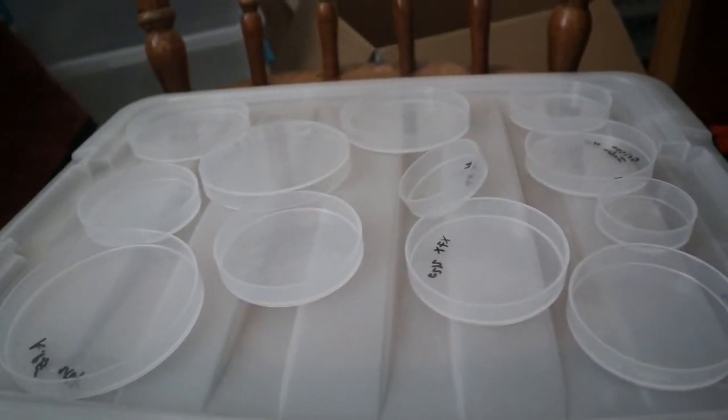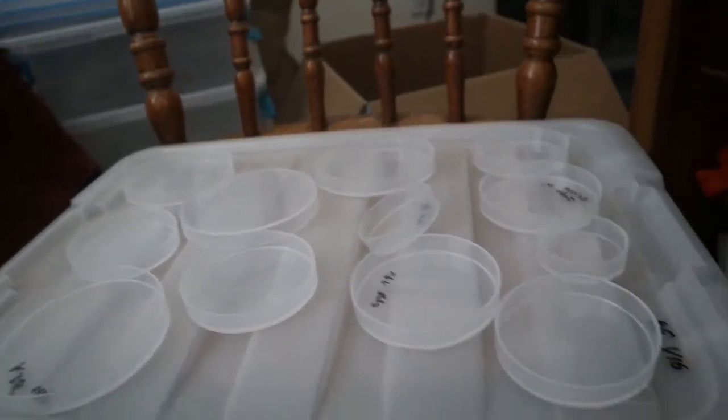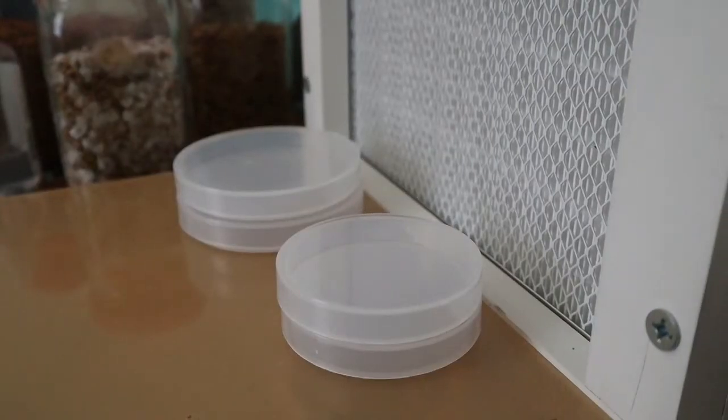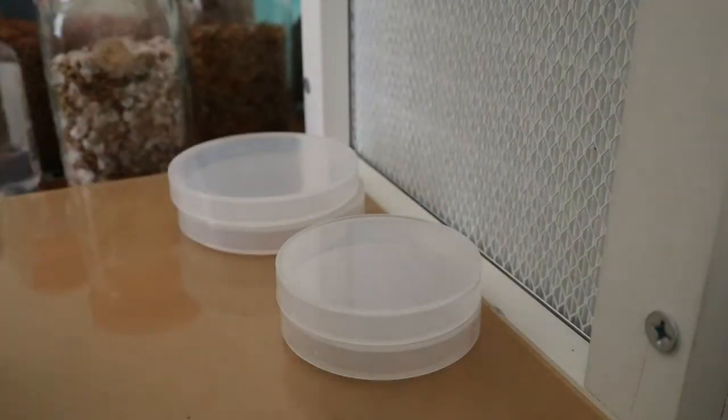Alright guys, I'll be back once I have these wrapped up in tin foil after I clean them all out with the rubbing alcohol and the rag. Alright, so I got my dishes all nice and cleaned up.